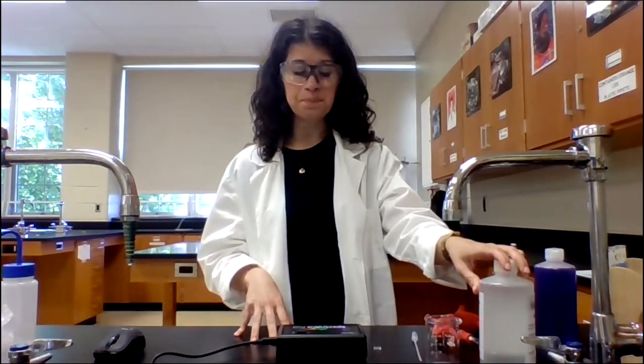Instead of using just a blank with just water, I used a blank that's half water, half sodium hydroxide solution. The point of that is to, again, zero out any absorbance from the sodium hydroxide solution. So I'm going to measure out, still using my serological pipettes, 10 milliliters of each solution. I'm going to stir and then quickly get them into a cuvette so that I can start measuring. You do want to move fairly quickly here once you mix them together, because we want to try to get our absorbance data as close to time zero when the initial reaction started as we can.